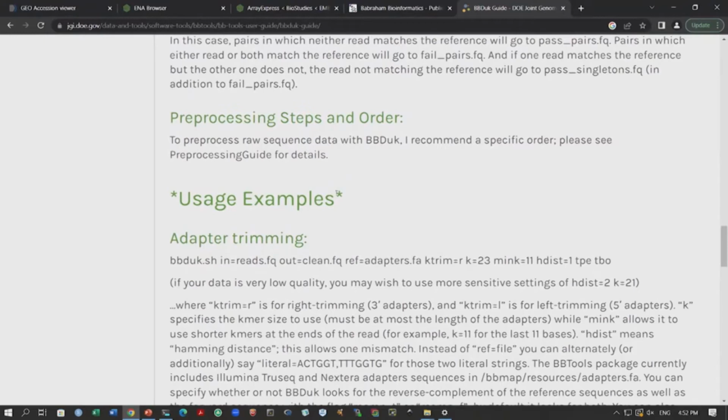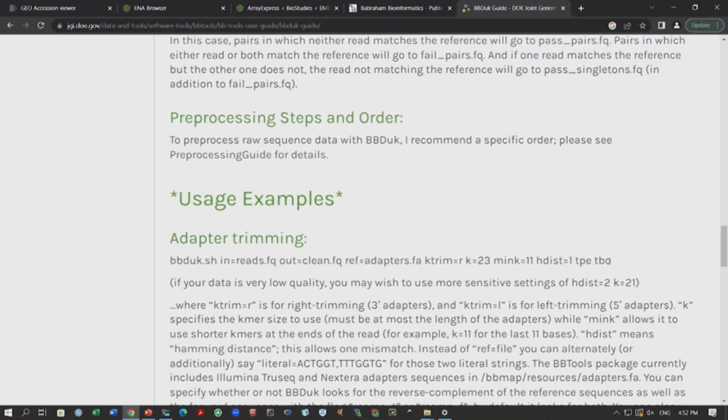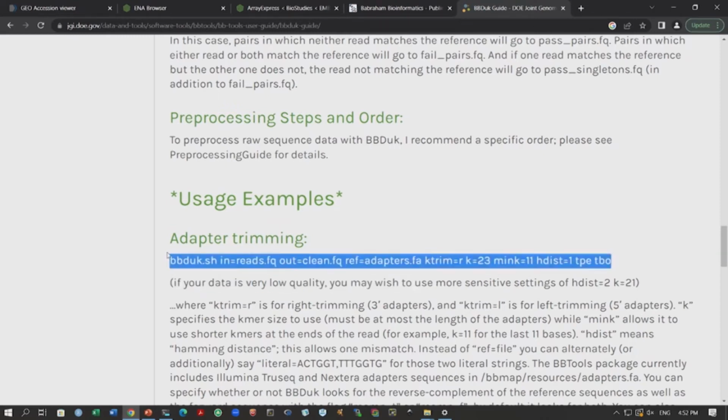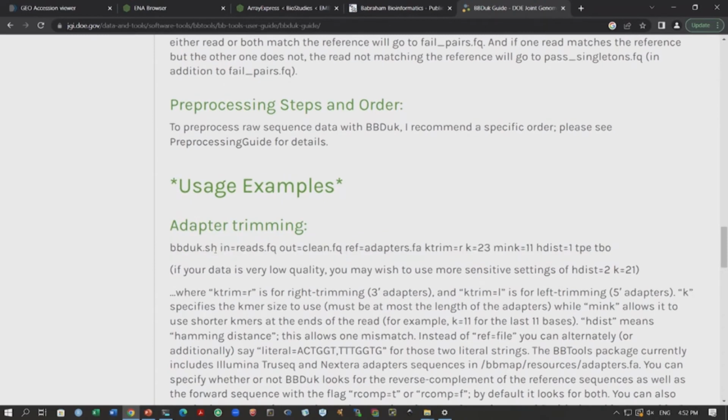So, what we will do is we will actually run our data through BBDuk, because we have adapter contamination, and you will see these commands. Now, I will explain this command, what you have in here. This is the command that will remove the adapters from your data.